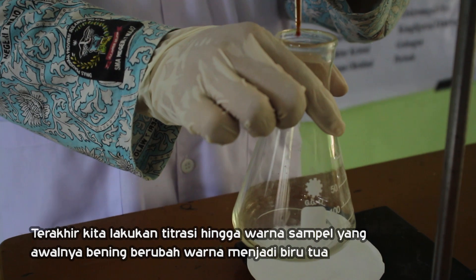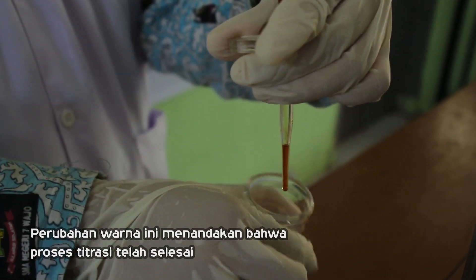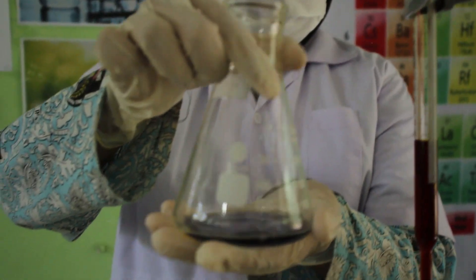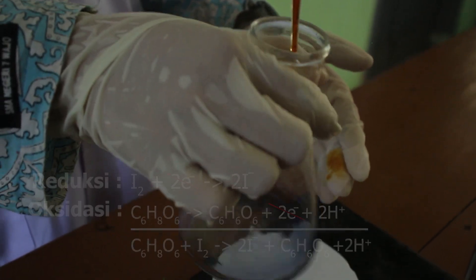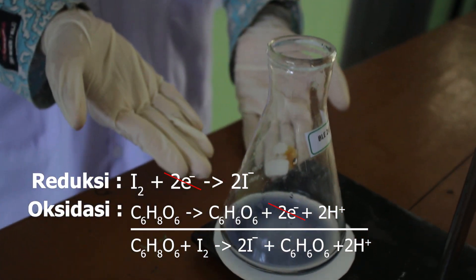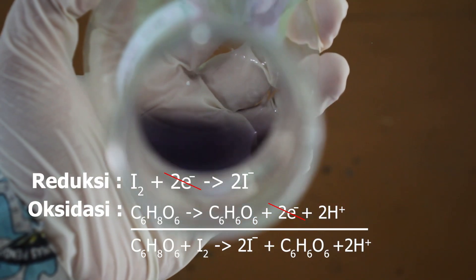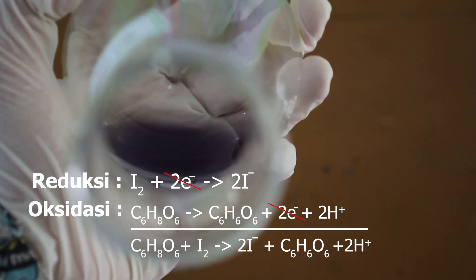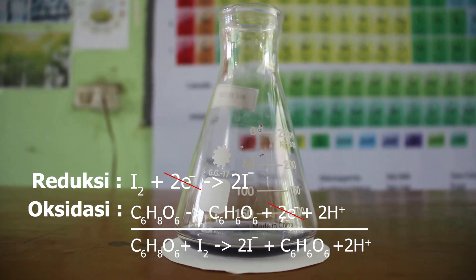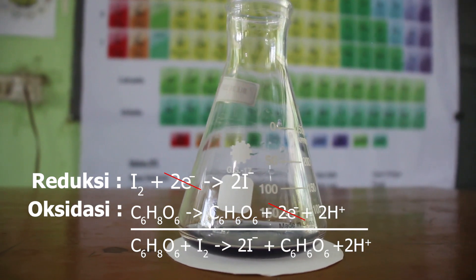Kita lakukan titrasi hingga warna sampel yang awalnya bening berubah menjadi biru tua. Perubahan warna ini menandakan bahwa proses titrasi telah selesai. Persamaan reaksi: pada reaksi reduksi, iodin menangkap 2 elektron menghasilkan ion iodida. Pada reaksi oksidasi, C₆H₈O₆ melepas 2 elektron menghasilkan C₆H₆O₆ dan 2 ion H⁺.